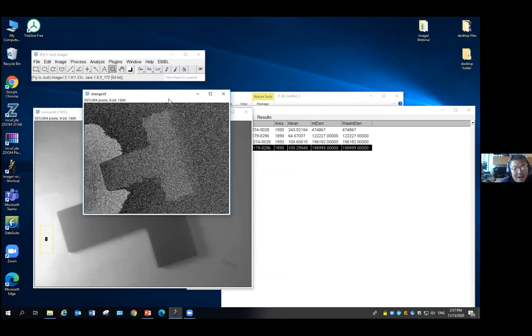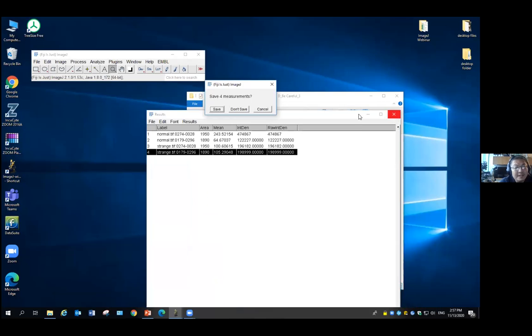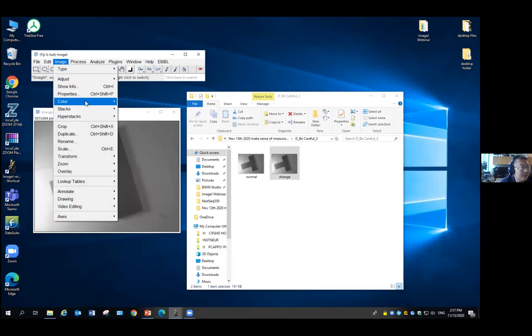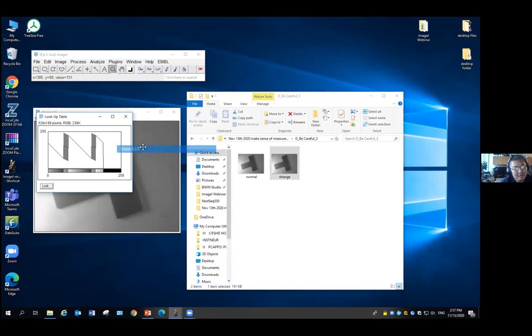Something changes on the image, right? But when we open that in ImageJ, we didn't see it, because it has something stored in its metadata. It's called the lookup table. You can see the lookup table for the image you open. You go to Color, Show LUT.